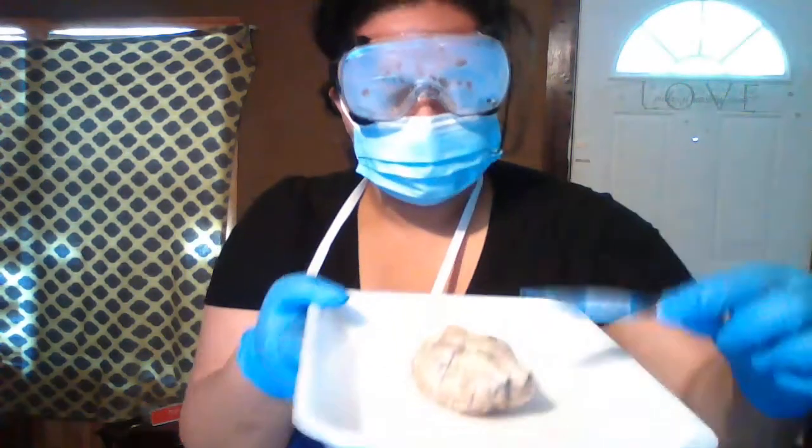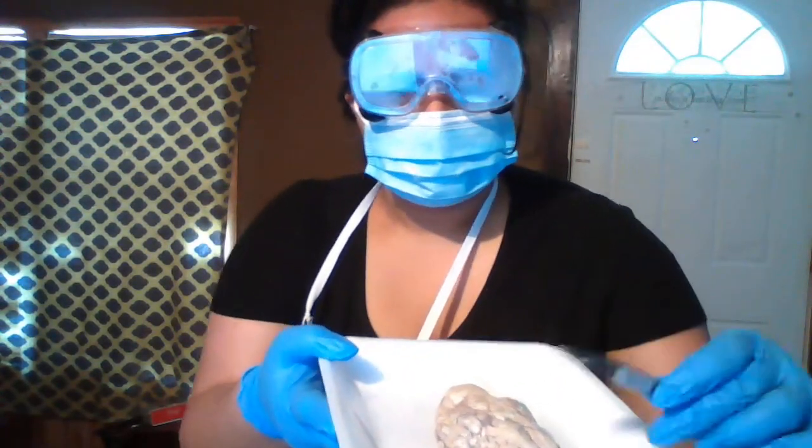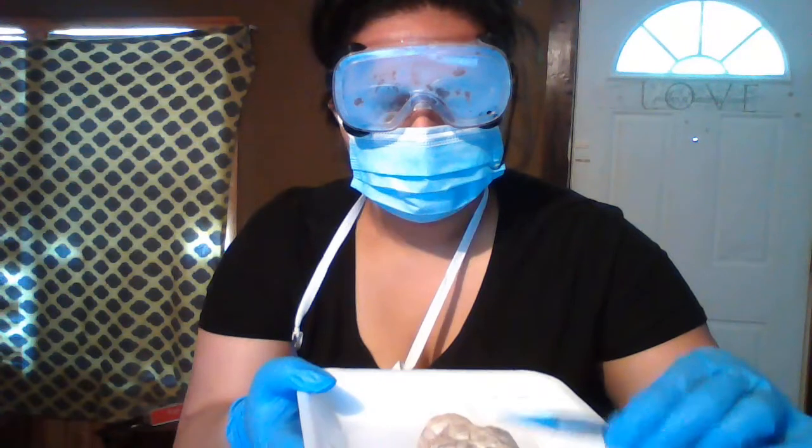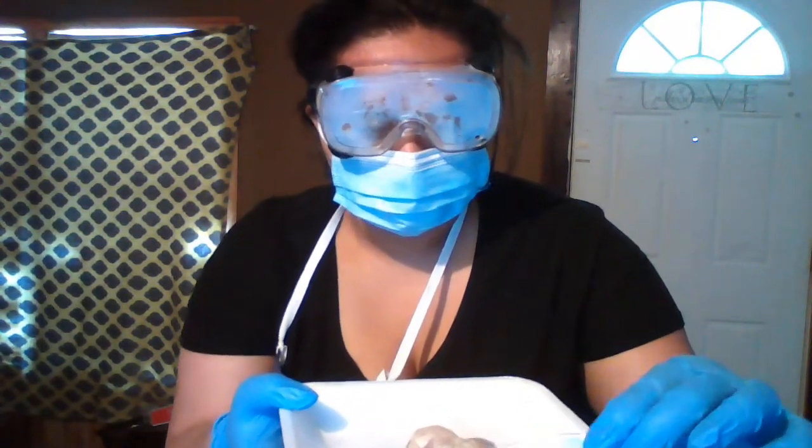Locate the optic nerve. Your optic nerve is anterior, almost right there at your optic chiasma. I think I said that.